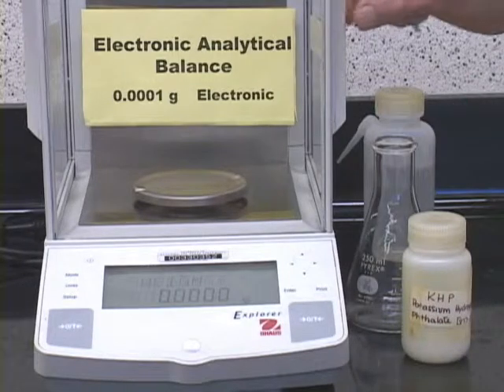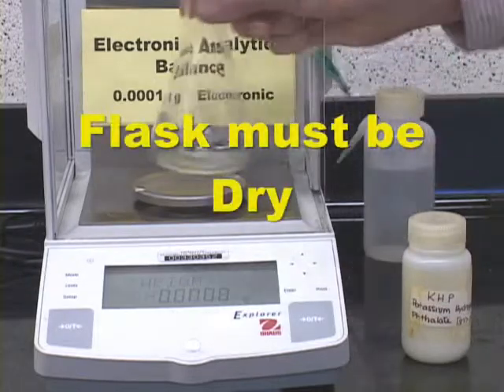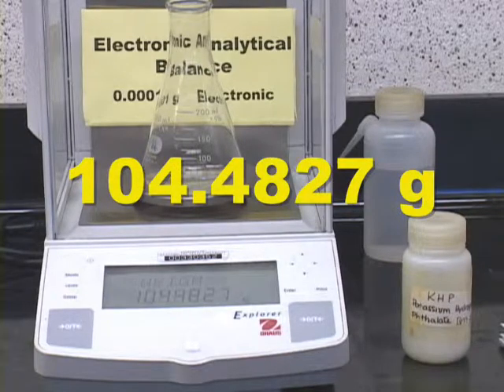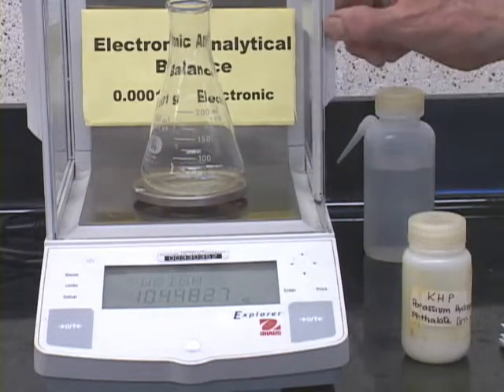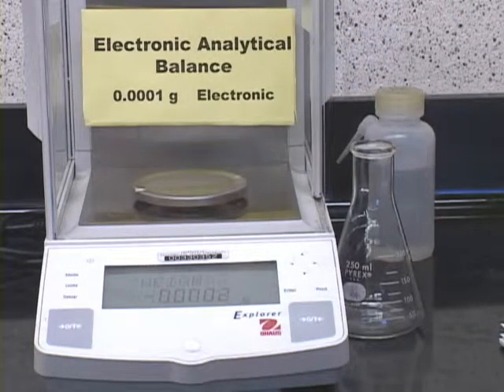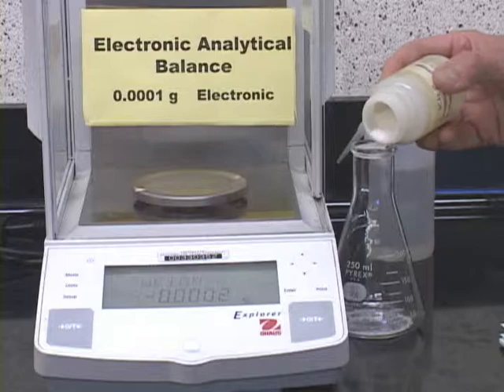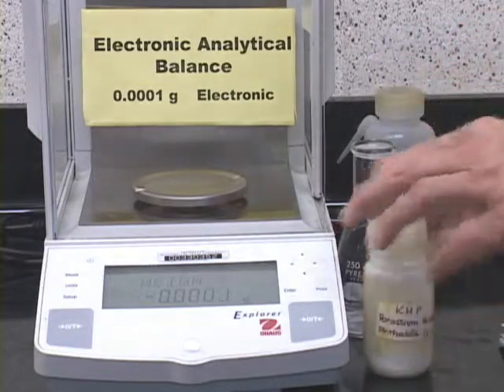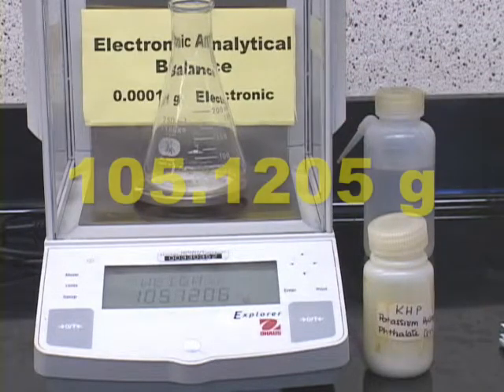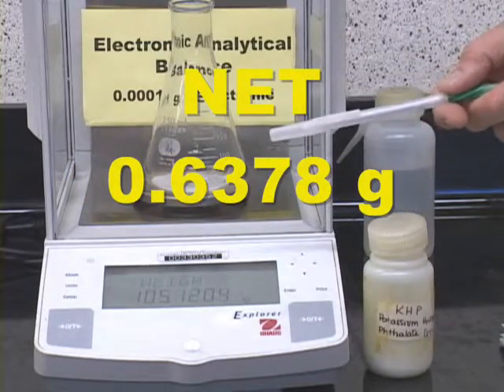Now, we'll be using a rather conservative method for weighing out the KHP here. We will first of all start out by weighing the empty flask. All right, it's 104.4827 grams. And now what we'll do is we will take this flask off the balance and add an approximate amount of KHP to this. We'll weigh it again, and there is our weighing here. The difference between this and the first weight is the weight of KHP in our flask.